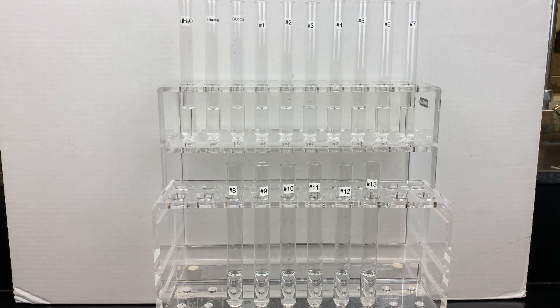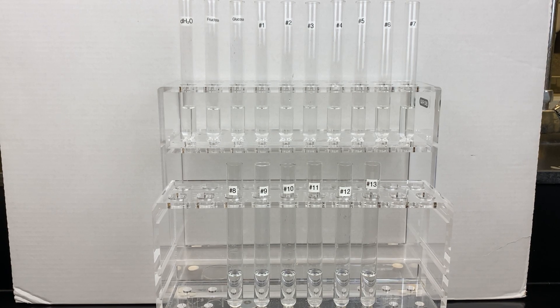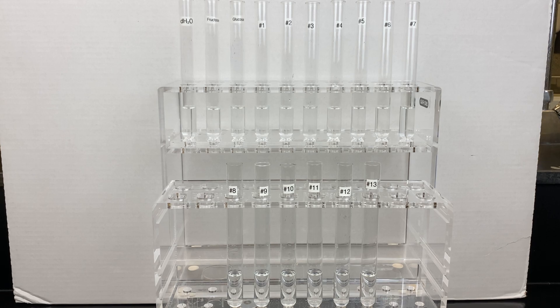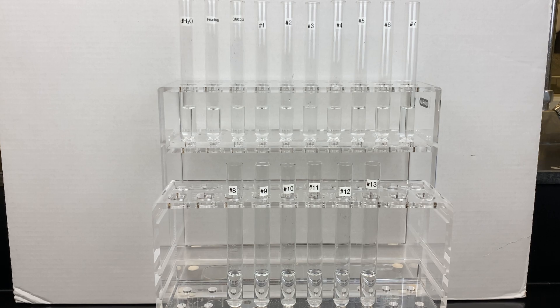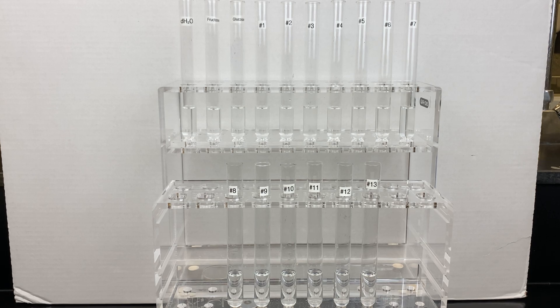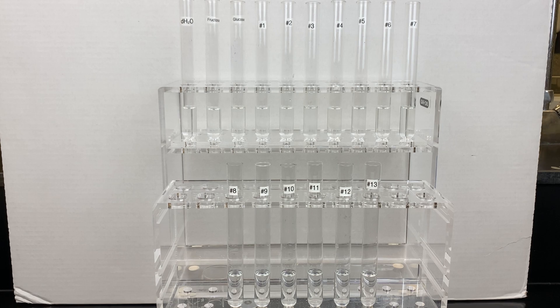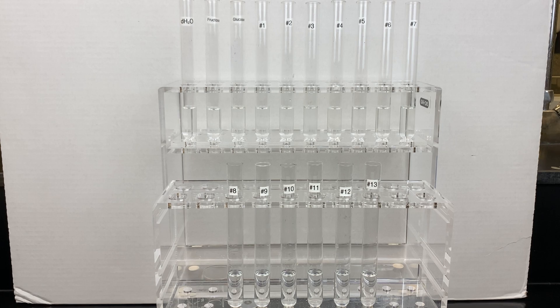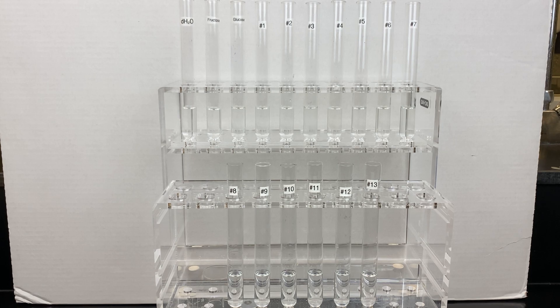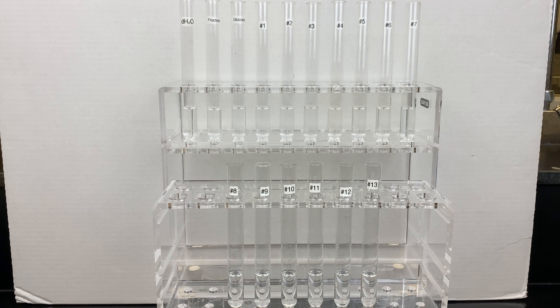Welcome to the lab. I'm Drew Collip. In today's lab we're going to continue our carbohydrate identification series with Seliwanoff's test. This test identifies ketoses as opposed to aldoses.